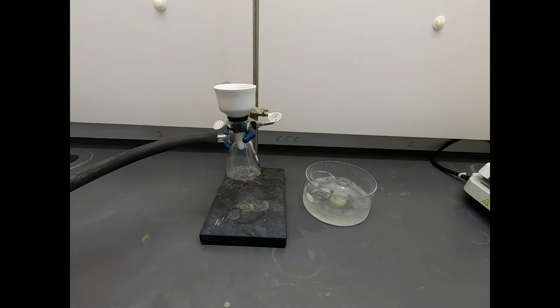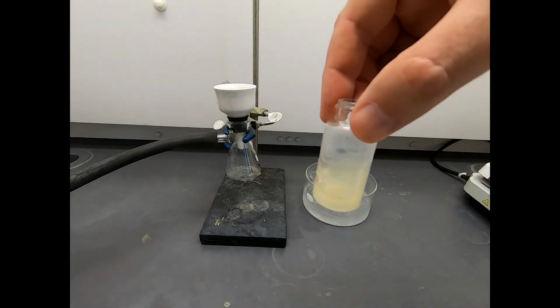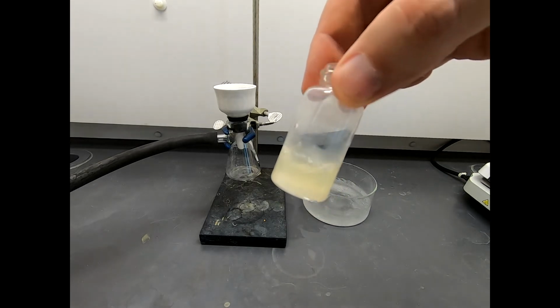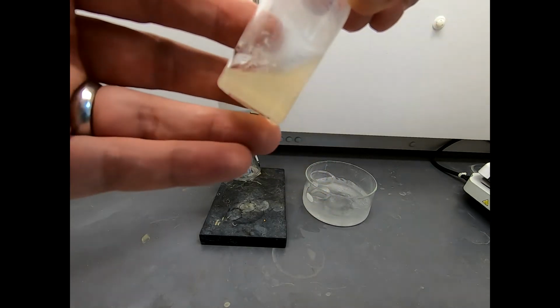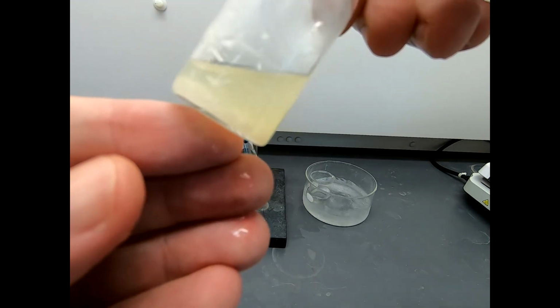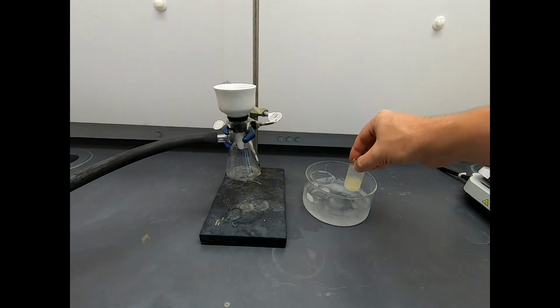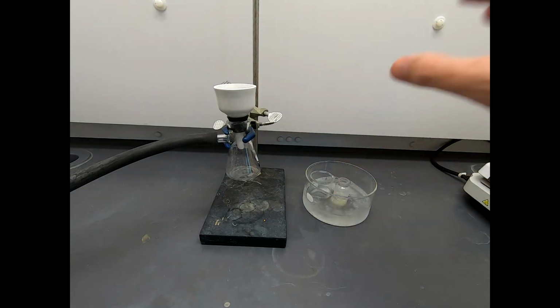Okay, we are ready to do some filtering. Now here is our precipitated product. I'm not sure if you can see that adhering a little bit on the sides. Definitely some on the bottom. It's a little bit cloudy, so it's hard to see through and see exactly where it's solid and not. But that's cold, it's precipitated. I think it's done. It's probably been on the ice for 10 minutes or so.